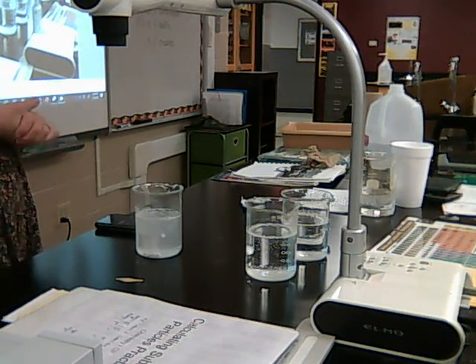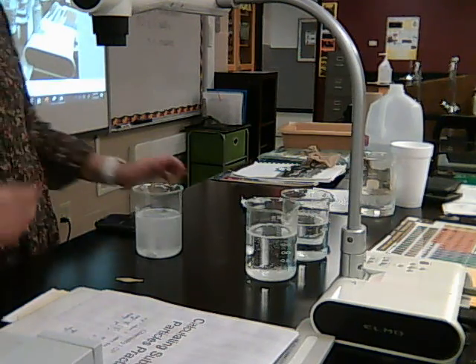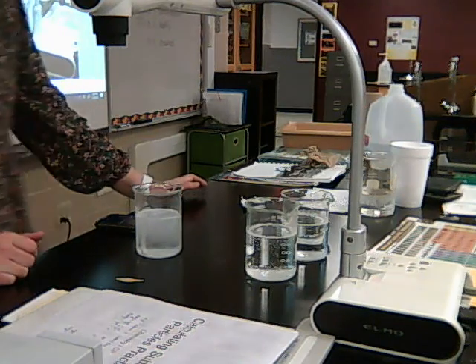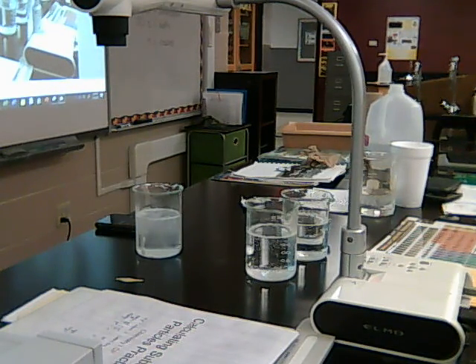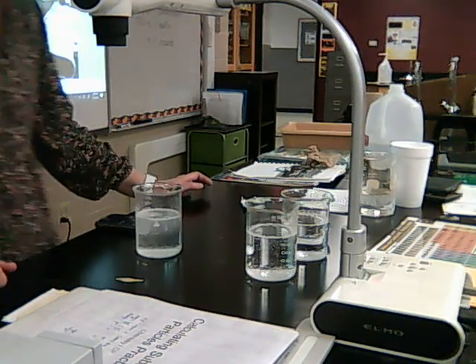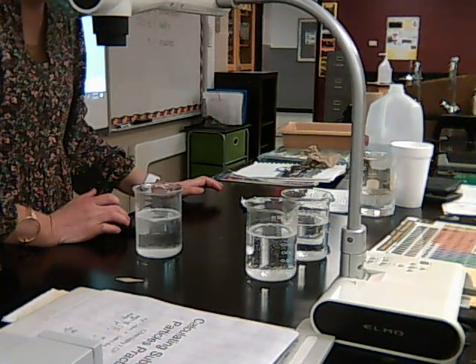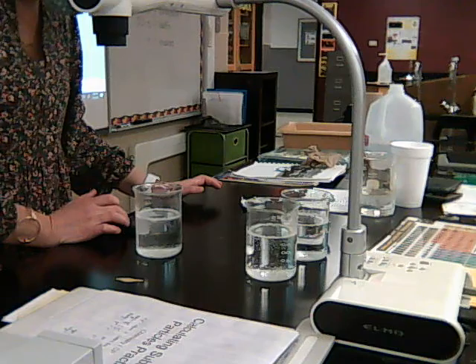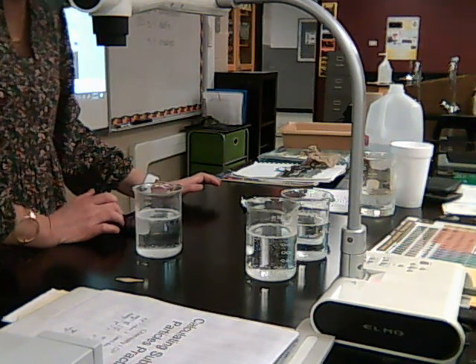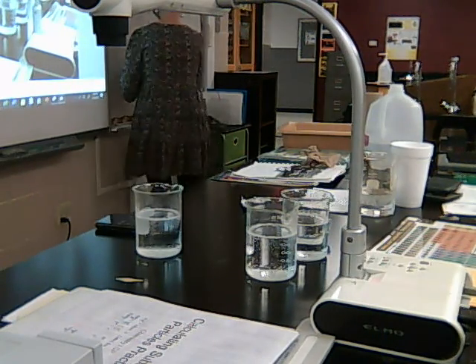There comes one piece to the top. Still a few pieces at the bottom. Oh, there comes another. There comes some more at the top. There comes the other one to the top. Yep, they're all at the top now. Okay, 51 seconds for the crushed.